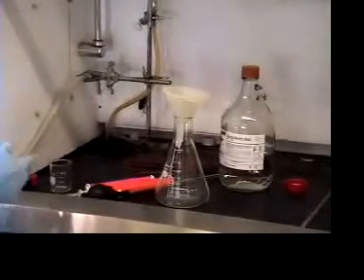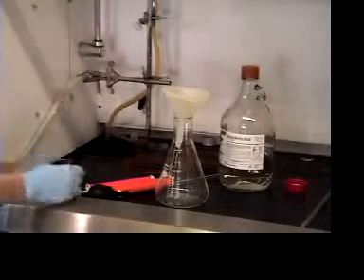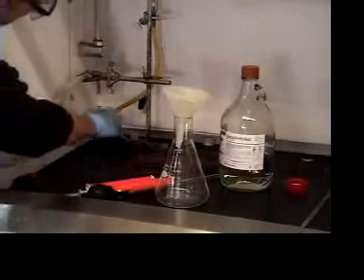Now we're going to take a sample of our CSTR. This feed line here comes from your suction pump, so it should be exactly what's in your CSTR. I'm just going to sample some of that.